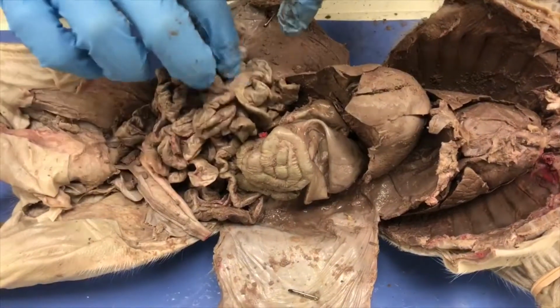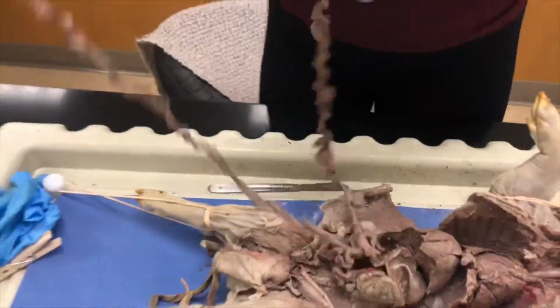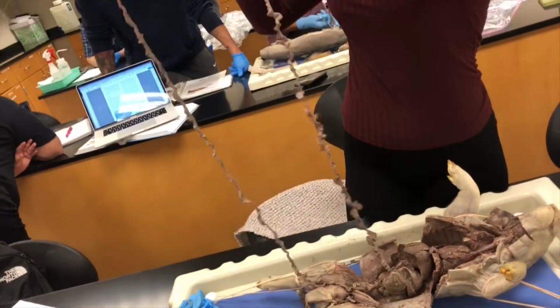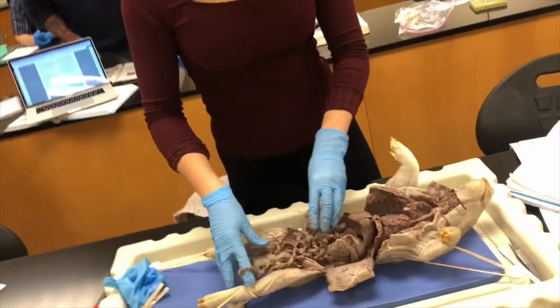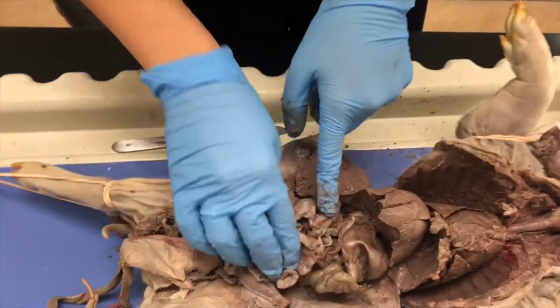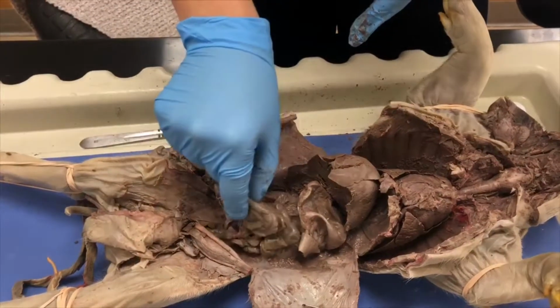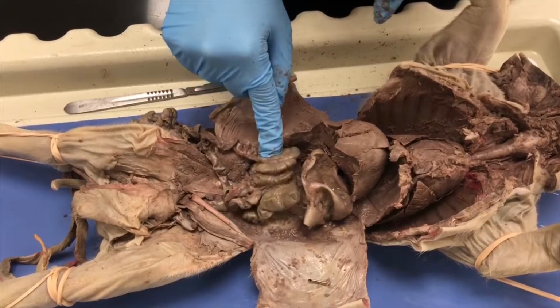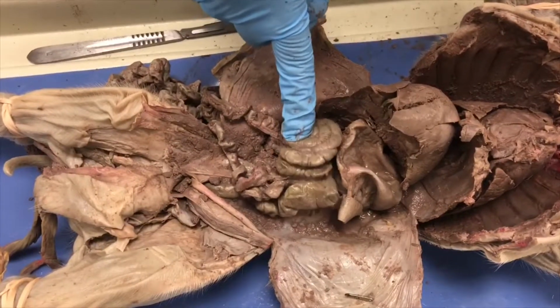The small intestine, which is right here, I will show you extended. Oh my god, yeah, it's gotten really big. Okay, I'll put it down now. It is responsible for chemical digestion and absorption of nutrients. The large intestine is a larger tubular structure that receives the liquid waste products of digestion, reabsorbs water and minerals, and forms and stores feces for defecation.